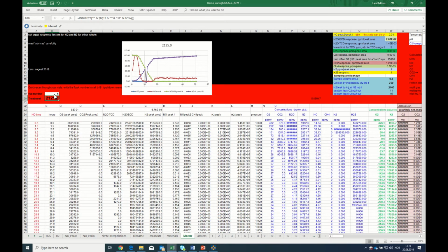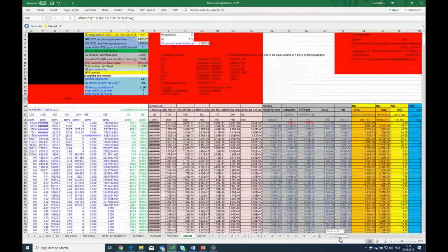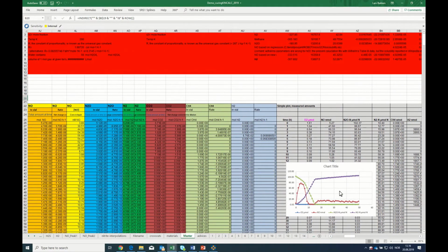But I'll just teach you one other way to inspect your data fast. If we go back to one and say that we want to compare all the vials with respect to N2O, to see how they take down N2O, so we could say that I want to make a table with my N2O in micromole N per vial in column AZ, and I want to plot all of them.